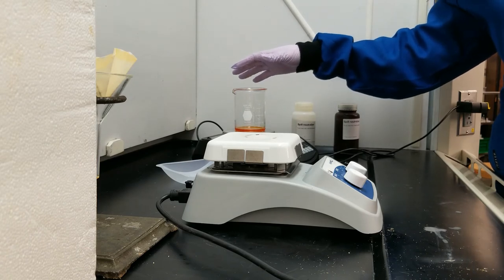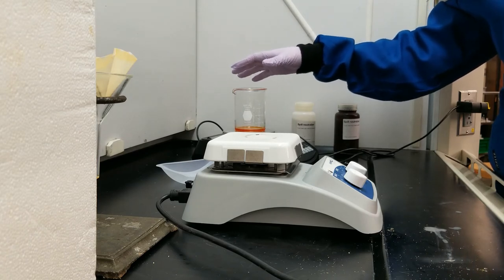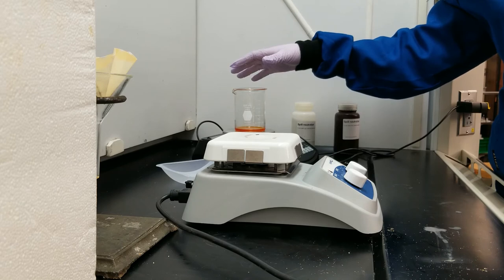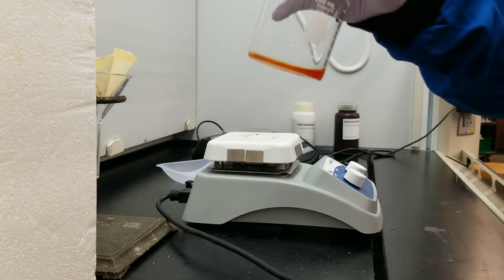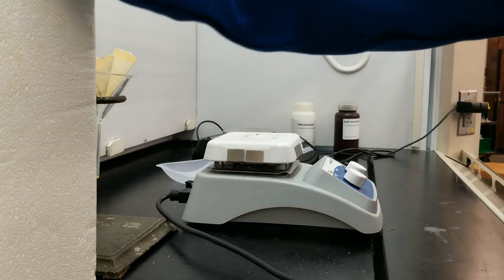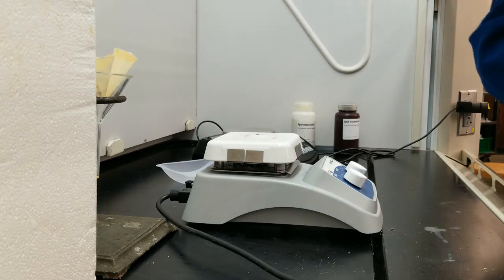So I have a mass of my beaker and my lipids, which is 115.16 grams. And then the last thing I'm going to do with this before I wash it and keep that mass of the empty beaker is I'm going to let it chill in an ice bath for a couple of minutes.